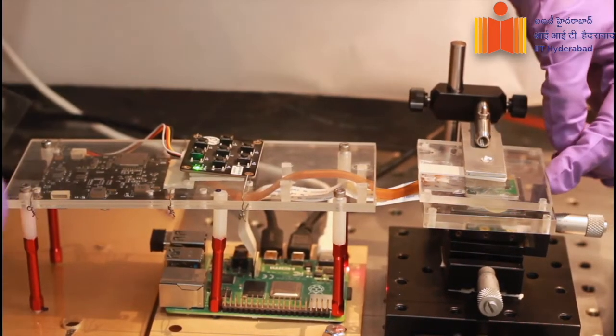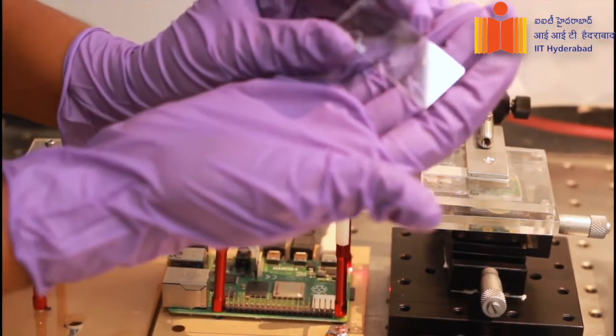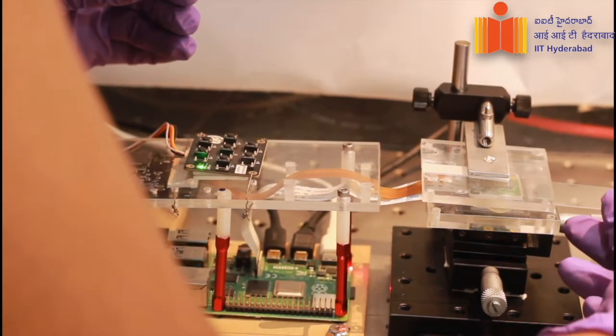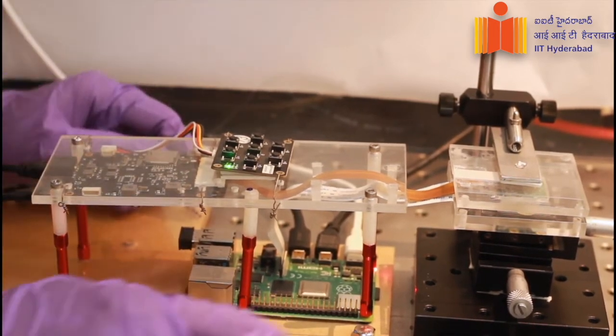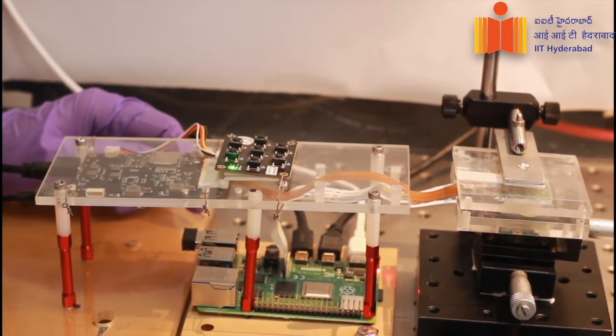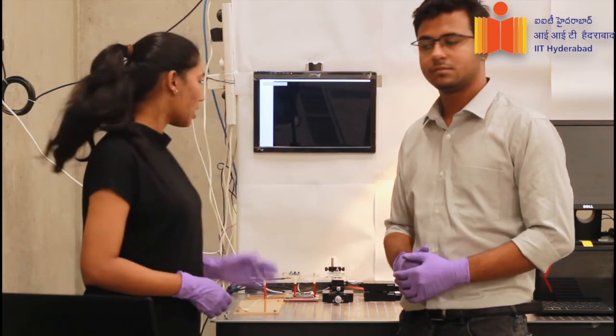The sample is placed between the micro LED chip and the camera sensor chip. Here is an example sample comprising 5 micrometer beads sandwiched between two coverslips. To perform imaging, we synchronize the illumination of the micro LED chip and the camera sensor chip using a Python script. We perform the experiment in the dark to avoid any stray light falling on the sample. We illuminate a single micro LED to perform imaging, and the holograms of the sample are captured and applied to an algorithm to retrieve the real image of the sample. This is how MuScope works.